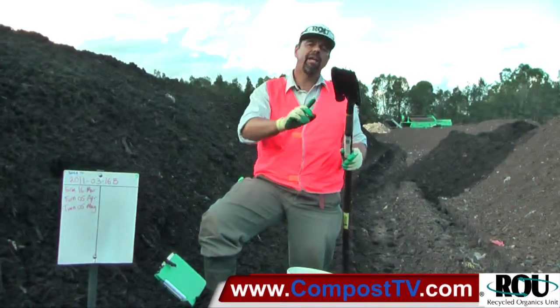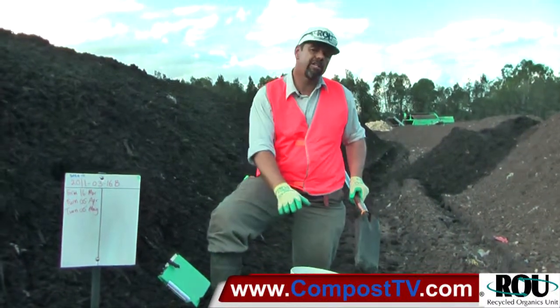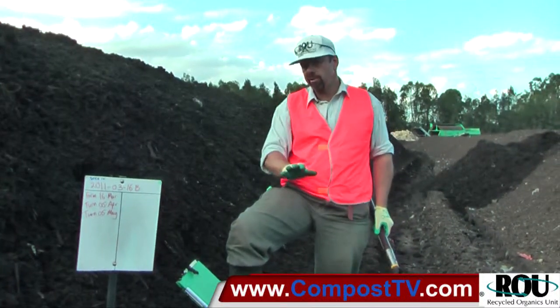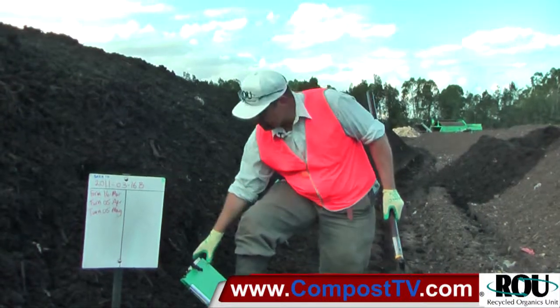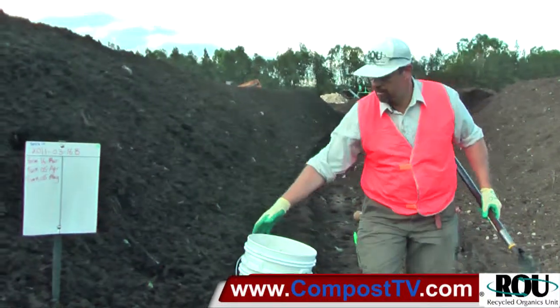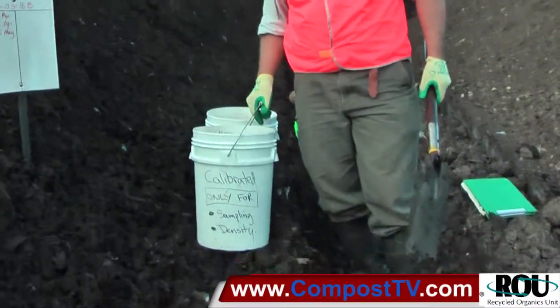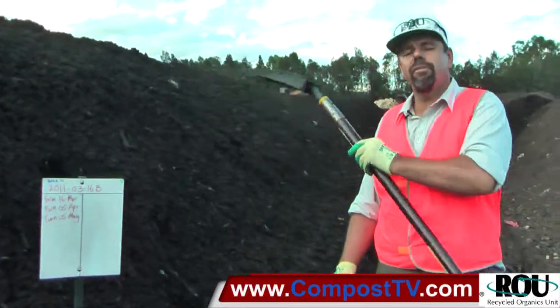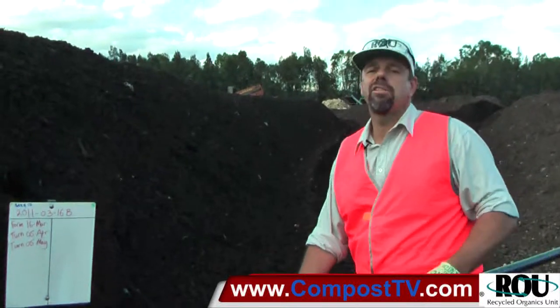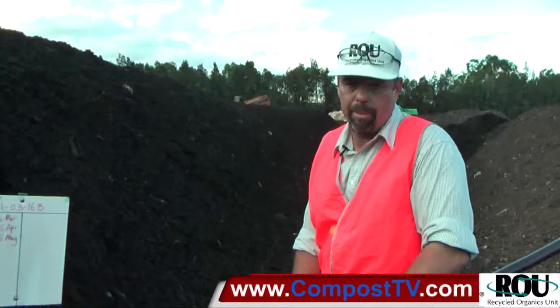The buckets and the spade are all nice and clean. I'll use the lids on these — once I've finished taking the samples I'll pop the lids on for when I'm carrying them back, to avoid any potential for cross-contamination from windblown materials over the rest of the site. So let's wander down the windrow and get our 13-odd sampling sites, extracting from both sides evenly along the pile. Since I'm sampling from both sides, it'll be an even number — probably more like 14 or 16 samples.